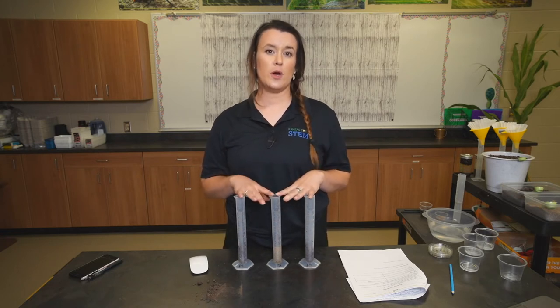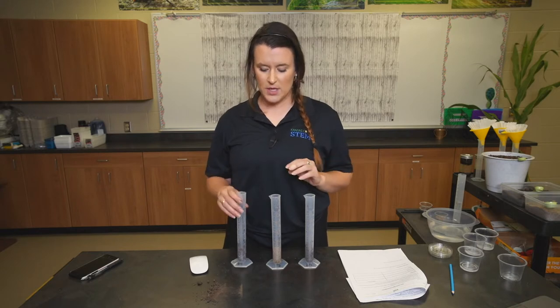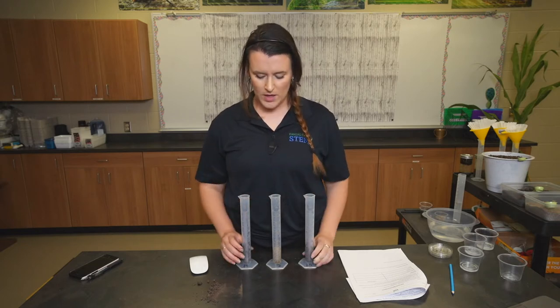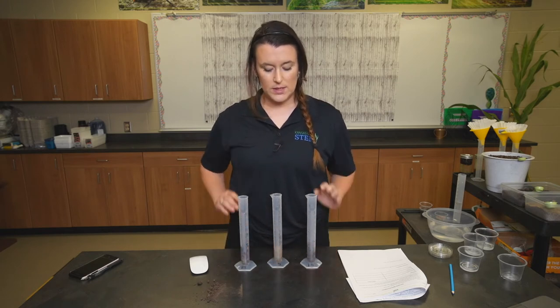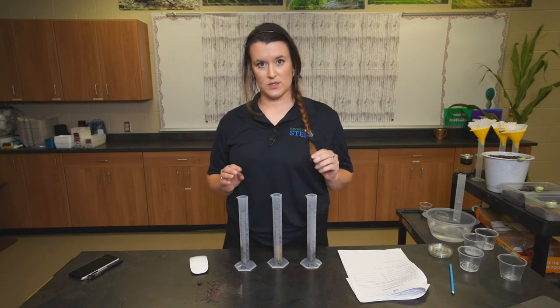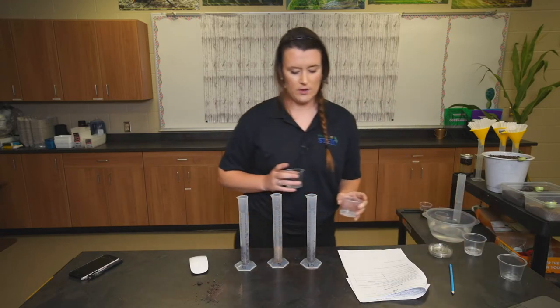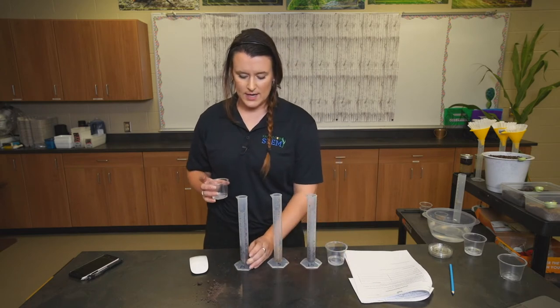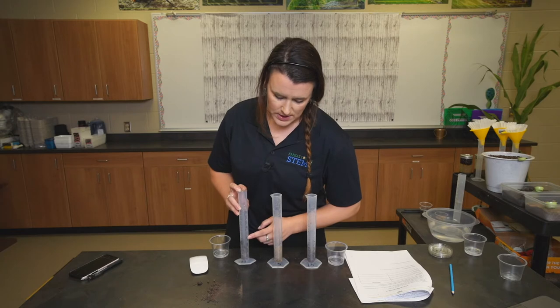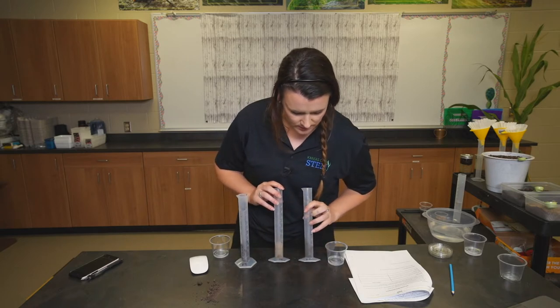Put 20 milliliters of the appropriate soil into your container. You can label them with post-its, or use a Sharpie — to remove it later, just rub an Expo marker over it and wipe right off. I've got potting soil, sand, and local soil. Have students knock the container against their hand or a table to make sure it settles so you don't have air pockets taking up space in your 20 milliliters. After settling at 20 milliliters, mark two times that height — on these graduated cylinders that's the 40 milliliter line. Then add 20 milliliters of extra water.